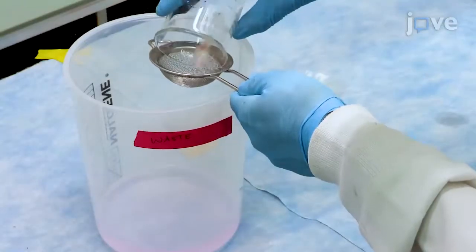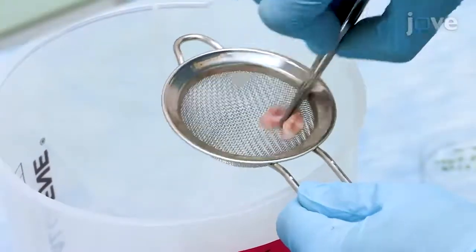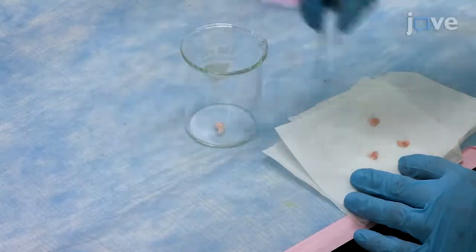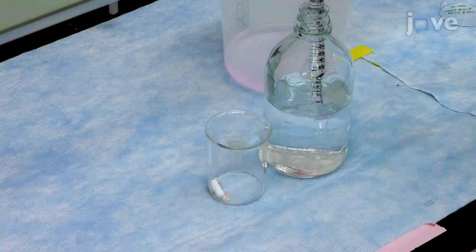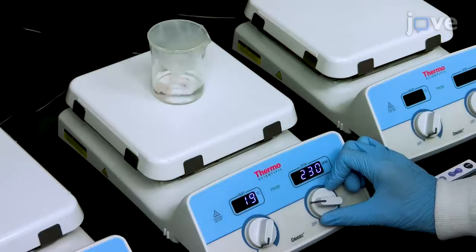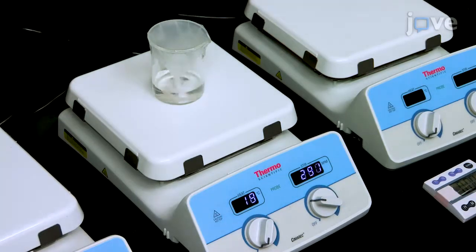Dump the beaker's contents into a 0.7 mm strainer. Use forceps to manually massage the tissue and place the contents back into the beaker. Wash the tissue by covering it with 60 ml of 1x PBS per gram of tissue. Stir at room temperature for 15 minutes. Repeat this entire washing process 1 more time.